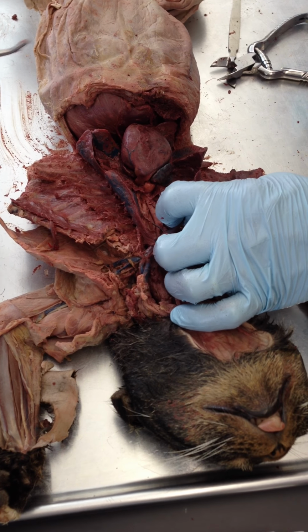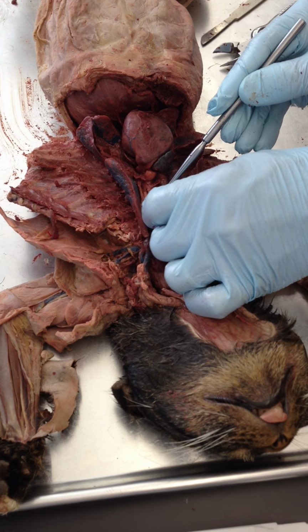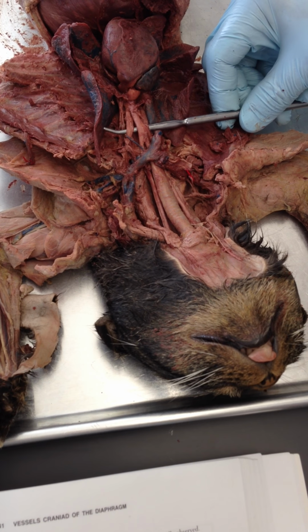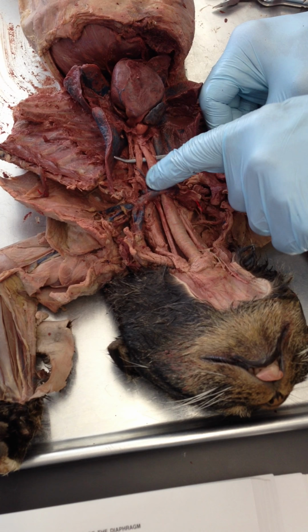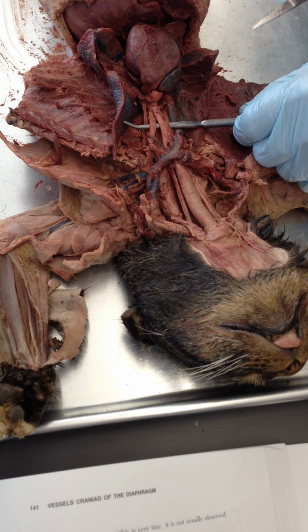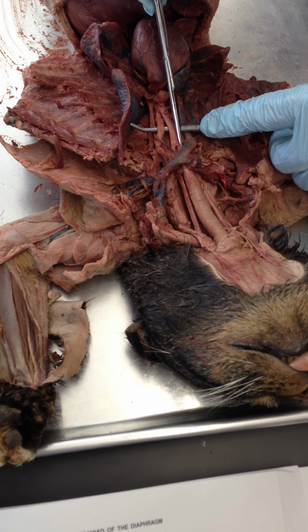So, let's see, I'm just going to... Want the probe? Okay, sure. So you showed me the two branching arteries off of the aorta. I'm going to lift them up right here. So those are the two branches. Oh, okay. Right. So you first described the brachiocephalic, and then the three branches off of that. The left common carotid and right common carotid.